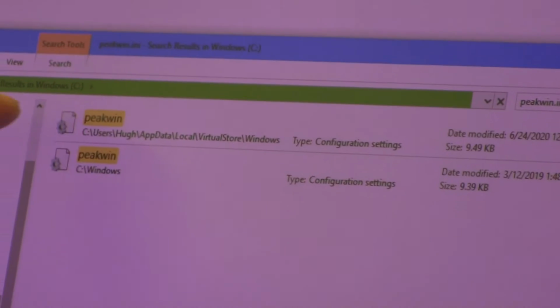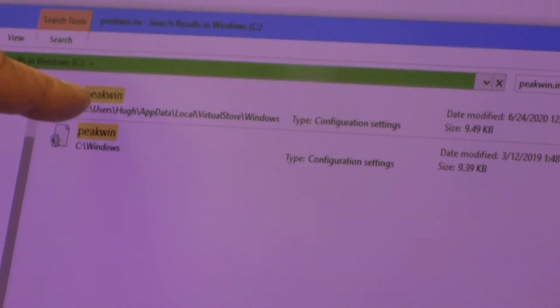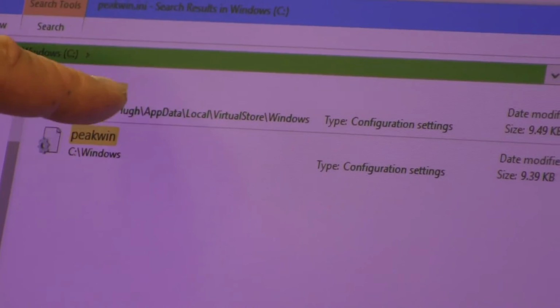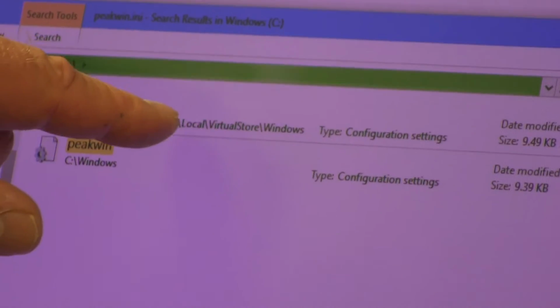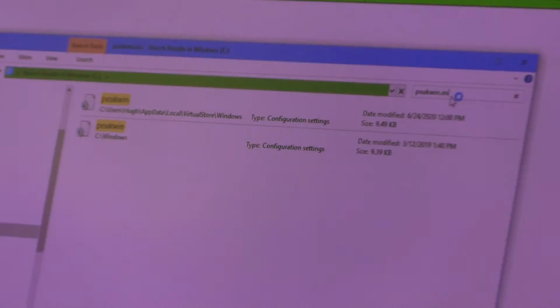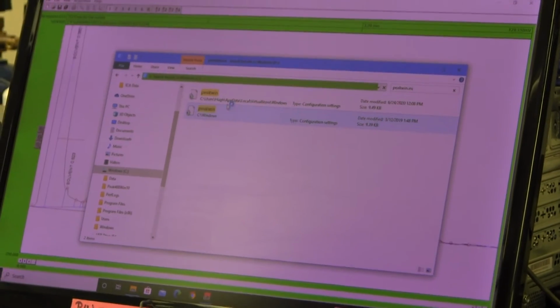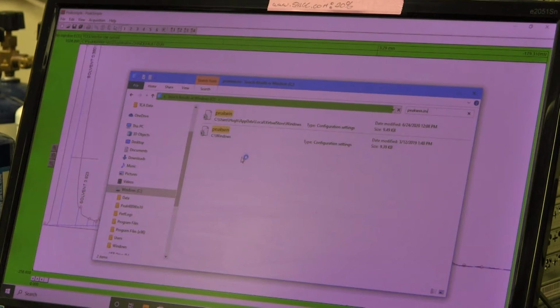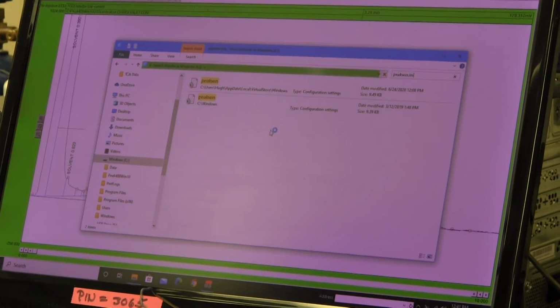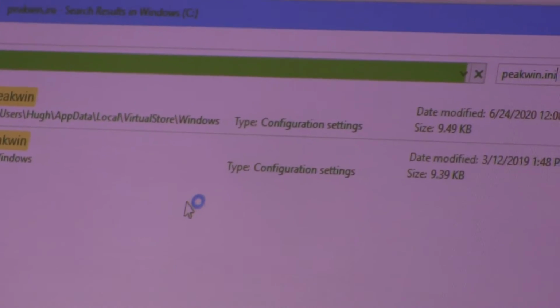There it is. See, this one is in the Windows folder, C:\Windows. The copy that counts is in C:\Users\Hugh\appdata\local\virtualstore\Windows, and it's not even the end. It's a longer string than that. But that's the file we need to go look at. So as soon as it shows up here, well, let's see, I've got an hourglass here. I can't move, I guess, until it finishes with this search. Looks like it's almost at the end.